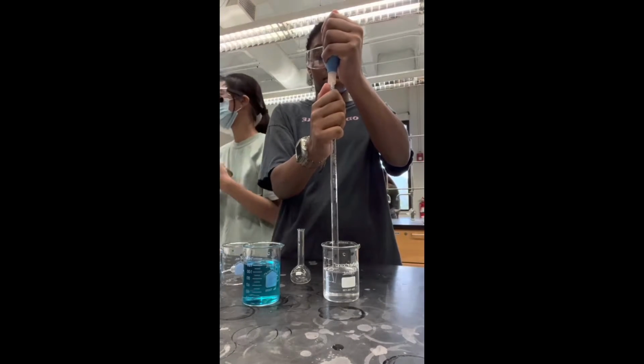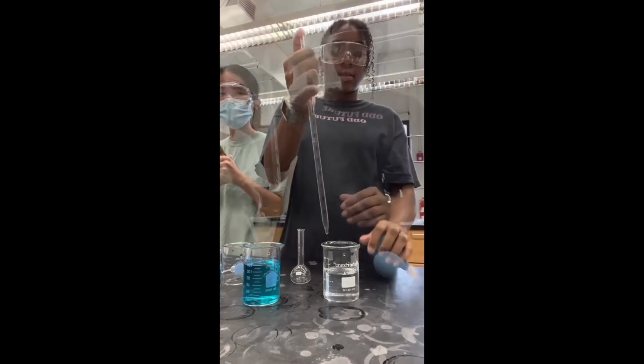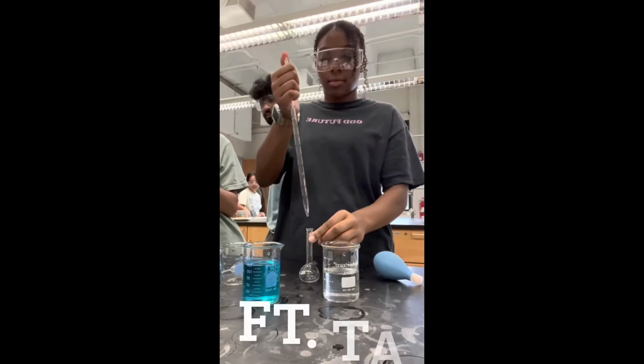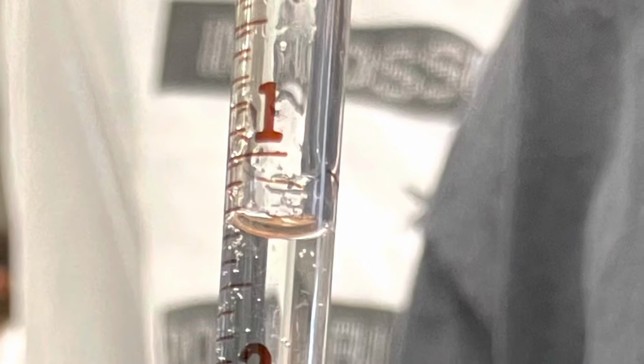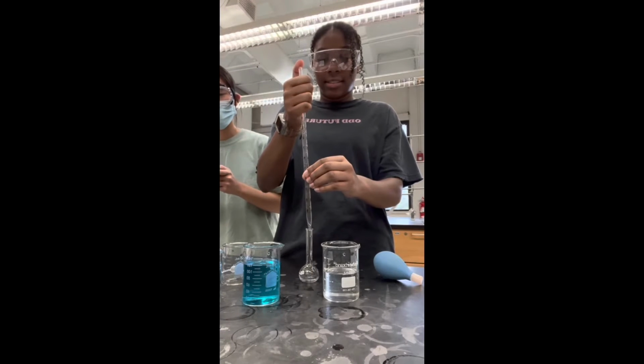The first thing we did was clean out the pipette with the blue water and the 20% stock solution. Then we proceeded to draw up the 20% stock solution without getting it into the bulb and covering it with our fingers. So this was Madison.